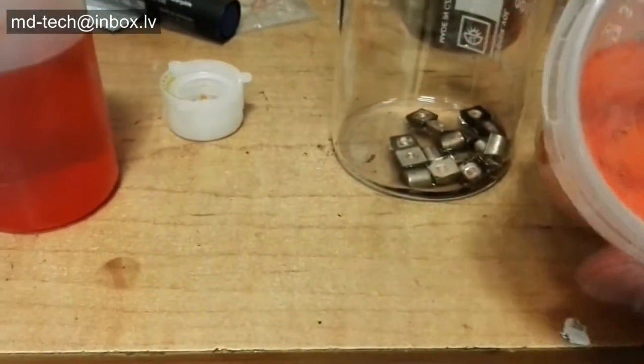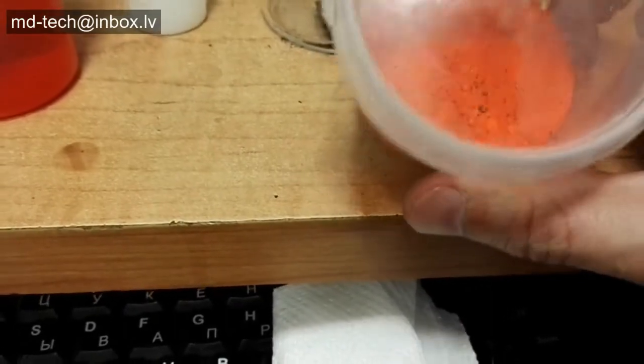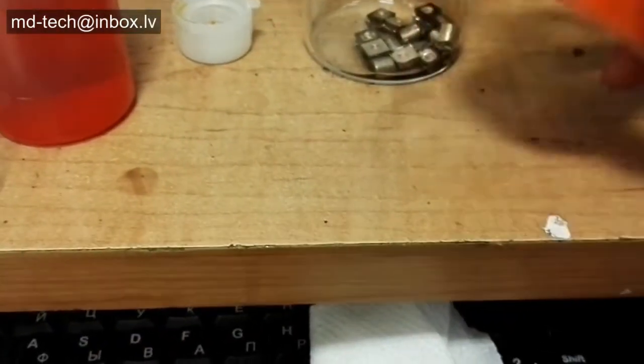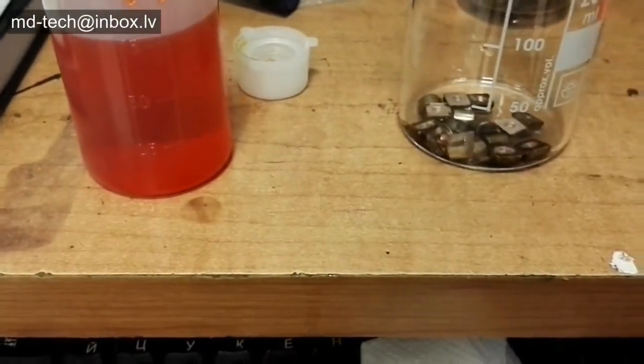I put clean silver contacts in a beaker. I use battery acid and potassium dichromate. This solution is very corrosive — do not touch with hands. Also, all chromium salts are carcinogenic. No fumes and no exothermic reaction follow. Silver is very quickly removed and the liquid turns dark brown.